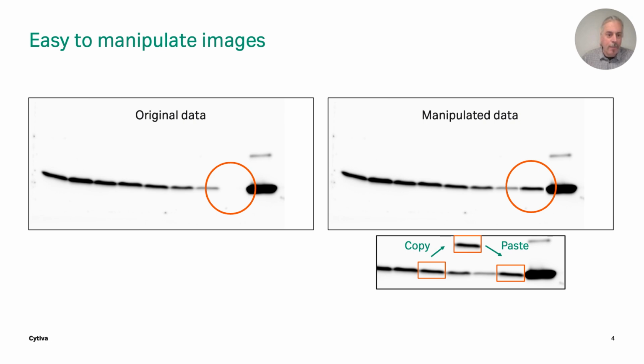So you can see in this example that we had an SDS-PAGE gel that's transferred onto a membrane, and they're looking at a particular protein here. And in this instance, you can see they've copied and pasted one of the other bands and placed it into the blank lane, just to create a story to hopefully back up the research that they're trying to push forward. But obviously this is fake data, so it's not believable, and it's a problem.